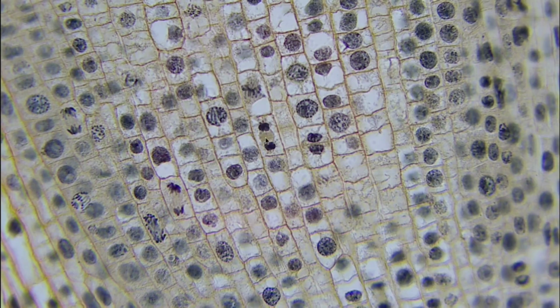That is going to be the cell wall, and that starts to form when we are saying these are two individual daughter cells now. So we're starting to close it off. These are two different cells. They're no longer one set of DNA. They have separated, and they are daughter cells, so they have the same genetic information. They're just two separate cells now.